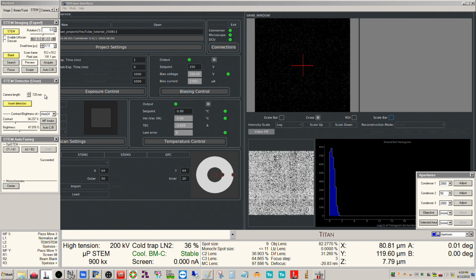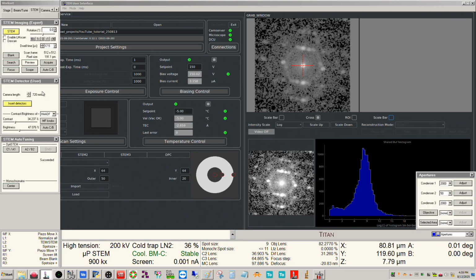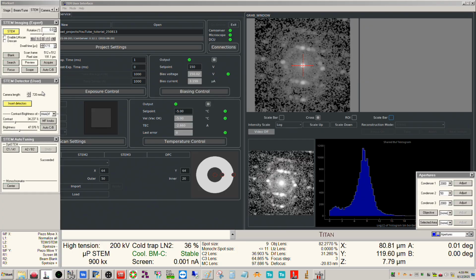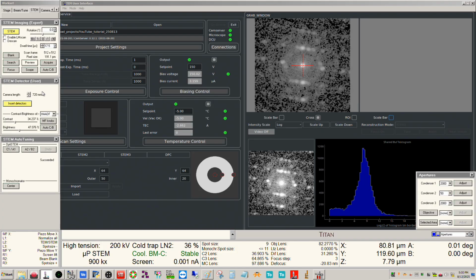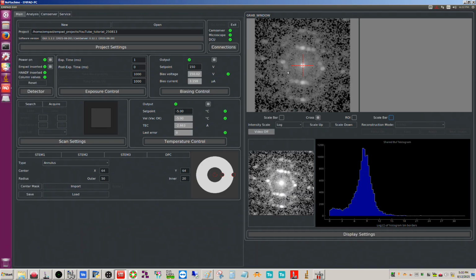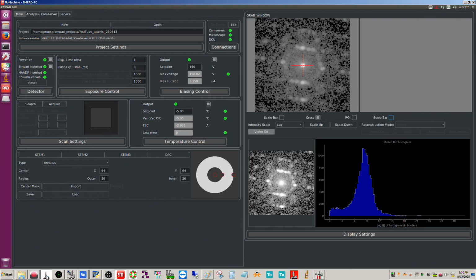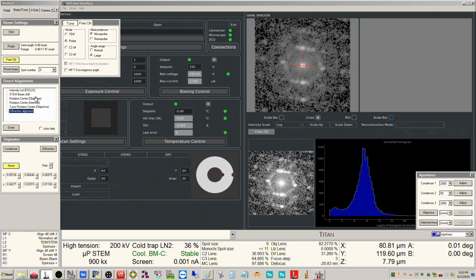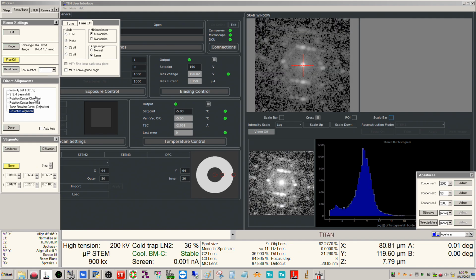Because I know that's going to be safer for what I want to do. So there's a video I did about making sure you don't oversaturate the EMPAD. So I actually know that for this beam geometry, 1 millirad, and this current, that we're going to be fine. Okay, so now if this is already centered really well, if this is not centered, you want to find diffraction alignments, and then you can go ahead and center it accordingly.